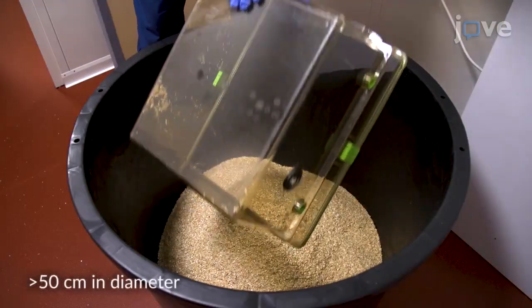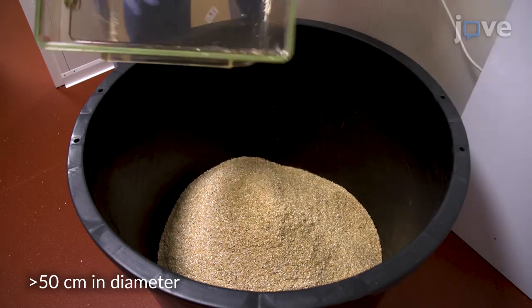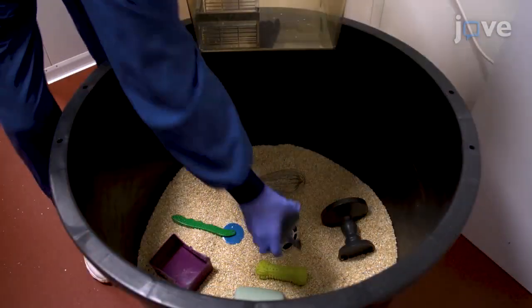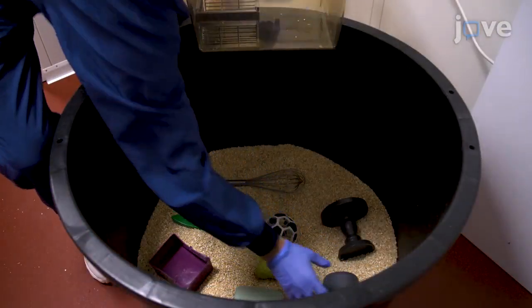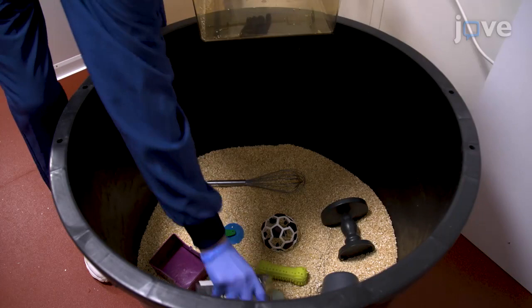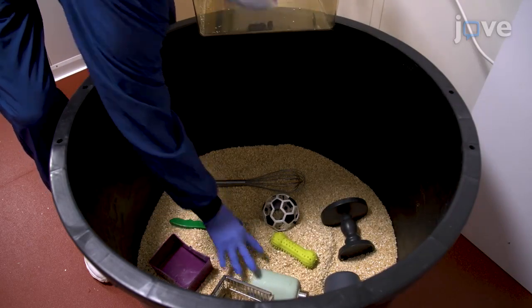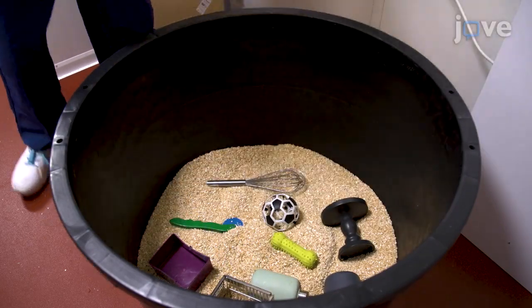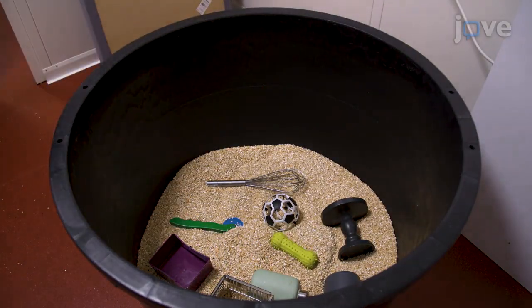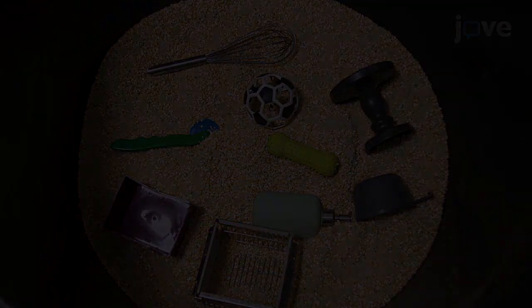Fill a non-square-shaped bucket with bedding material. Randomly place 5 to 10 objects of different shapes and sizes, which are different from the objects that are going to be used in the experiment, into the bucket.